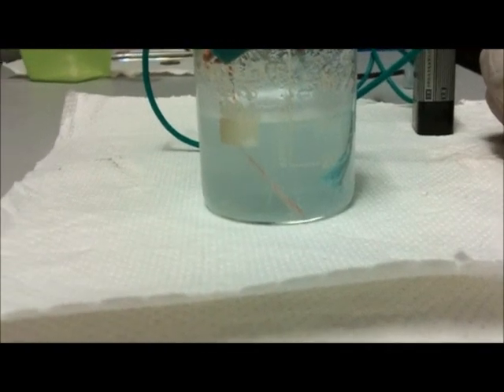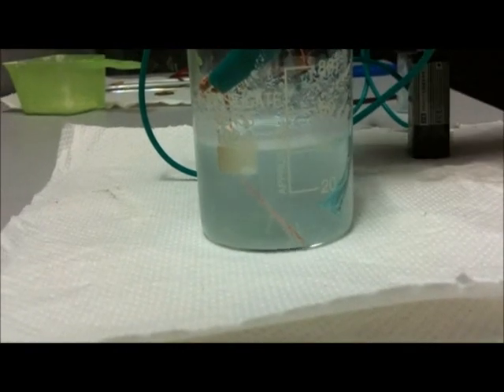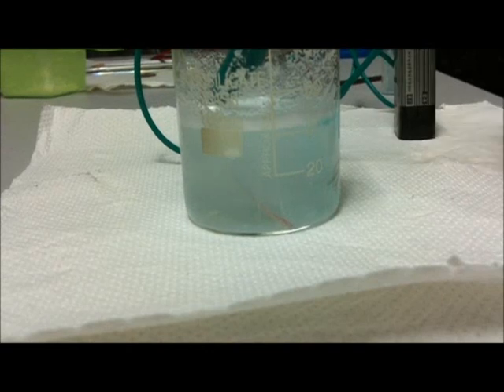At the positive electrode, the copper reacts with the hydroxide ions to form copper 2 hydroxide, which is deposited on the surface of the copper wire, which is the electrode.